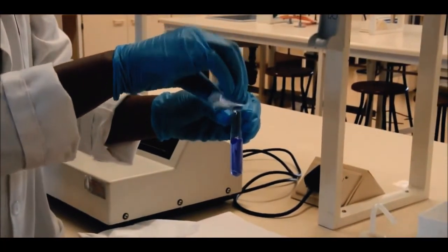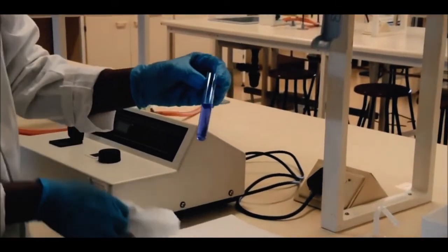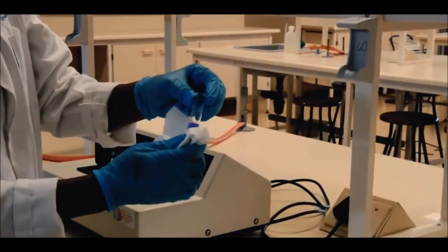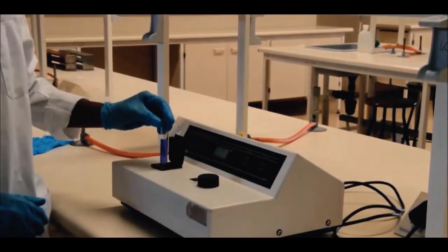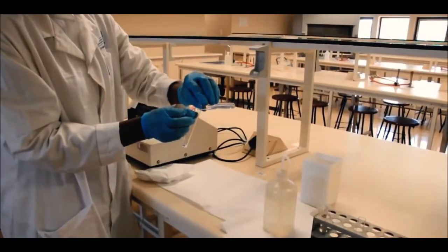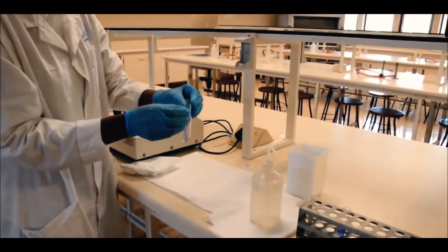The cuvette is once again wiped with the paper towel to clean the outside and remove any liquid before the cuvette is inserted into the spectrophotometer. Repeat the same test procedure. Never leave the cuvette inside the spectrophotometer.